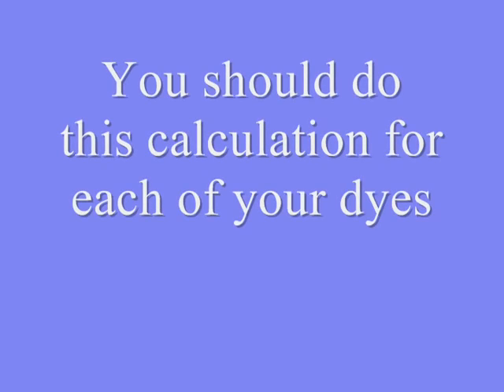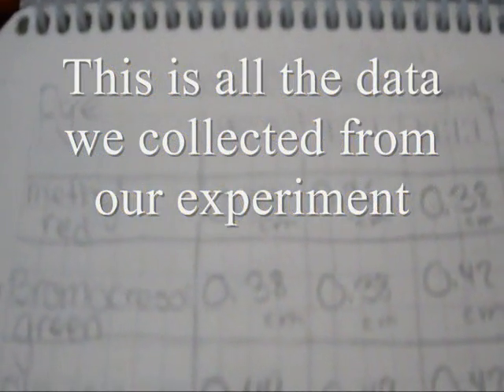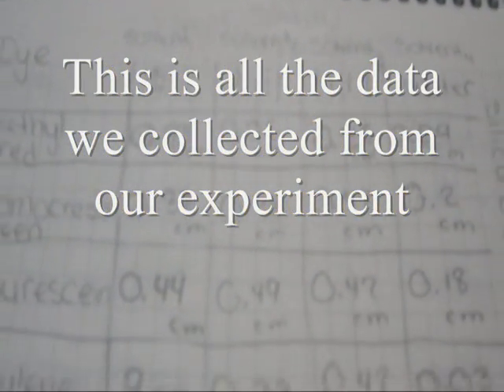And now we divide 2.25 divided by 6. And that's going to give us 0.37.